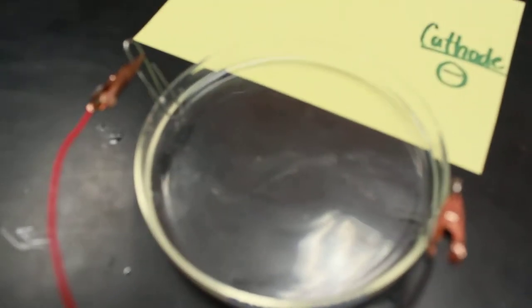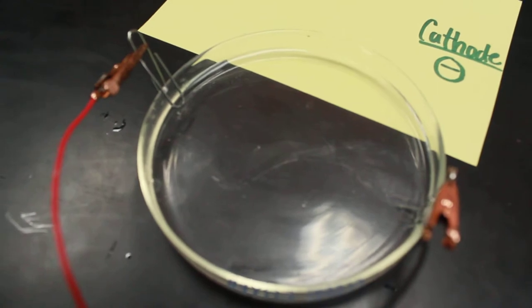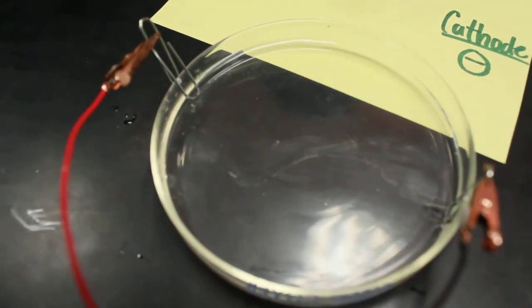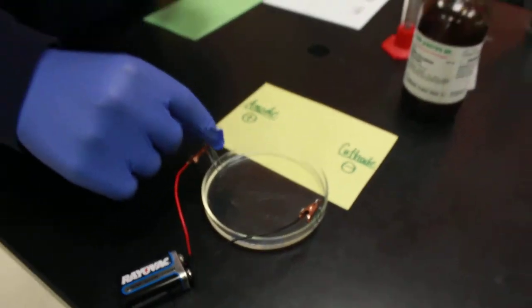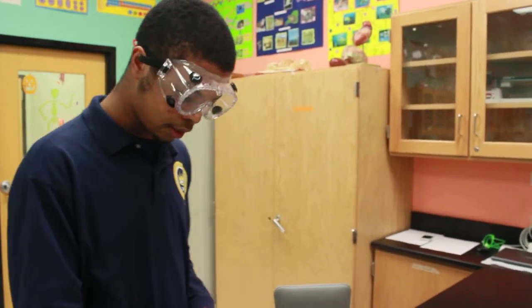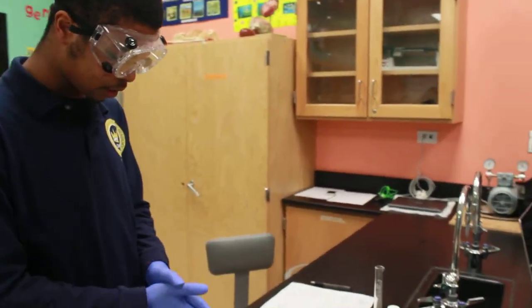So we're going to be observing this for a little while, which is just metallic tin crystals on the cathode, and on the anode side, we're creating a white precipitate of tin chloride.